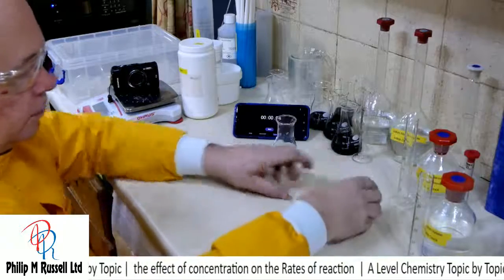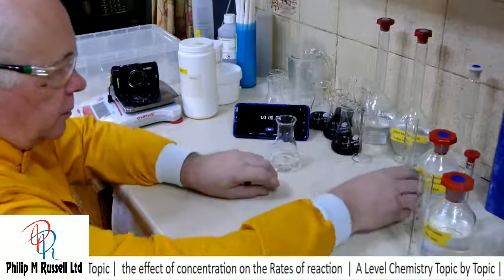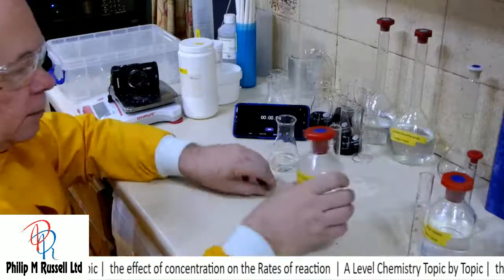And we'll give it a good swirl. I used those beakers in the past, so they're going to be alright. They've only had the same thing in them.